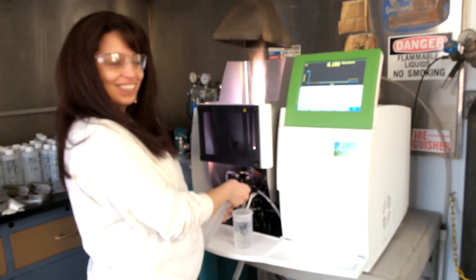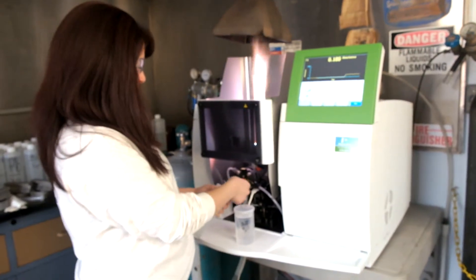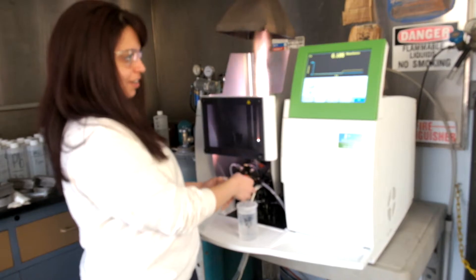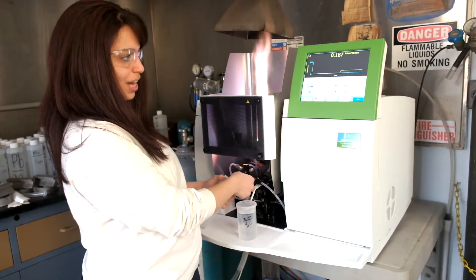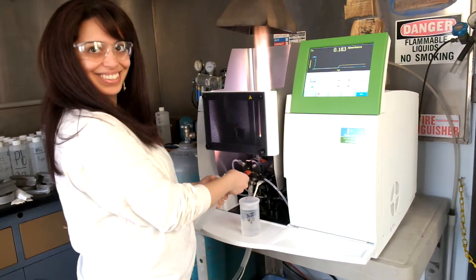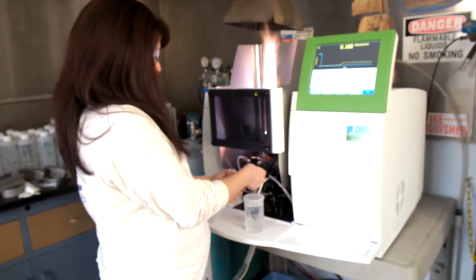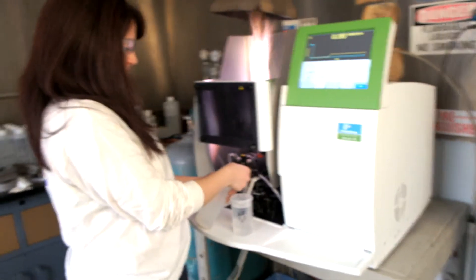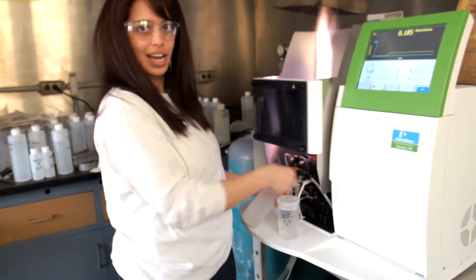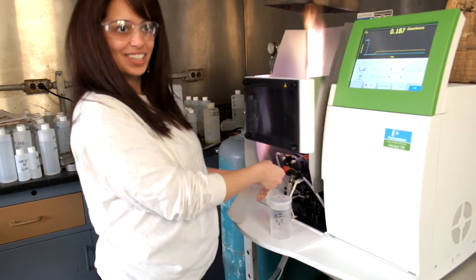And what do you do with it? I measure the absorbance of metals with it. So I see how much parts per million of metals is in it. Basically, it's measuring minuscule amounts of metals to see how much there is in water. Oh, okay.